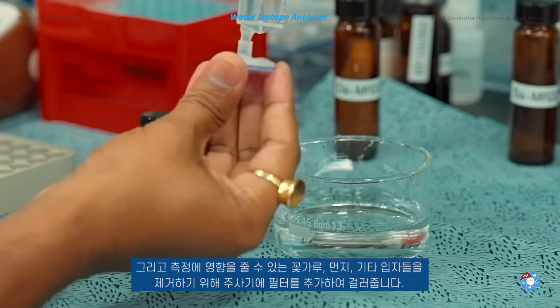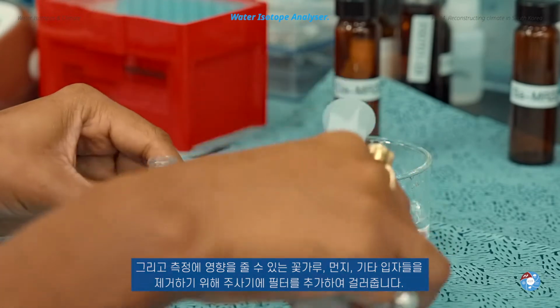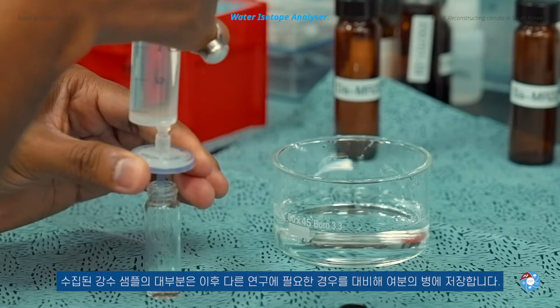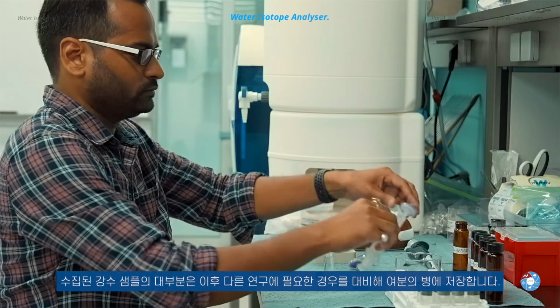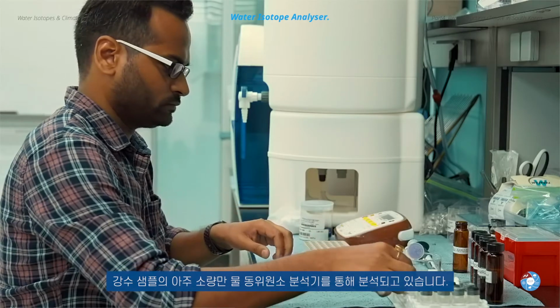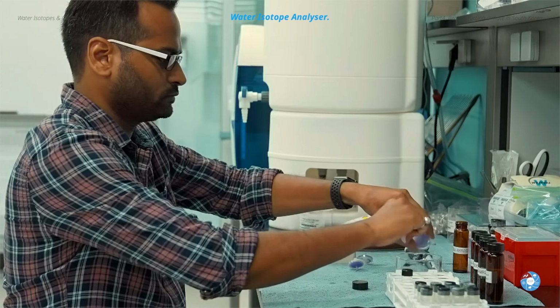Then we add a filter onto the syringe to remove pollen, dust and other small particles that could impact our measurements. The largest part of the collected water is stored in extra vials in case we want to conduct more analysis in future. Just a tiny little part of the water that is collected by KWIN will be analyzed in our water isotope analyzer.